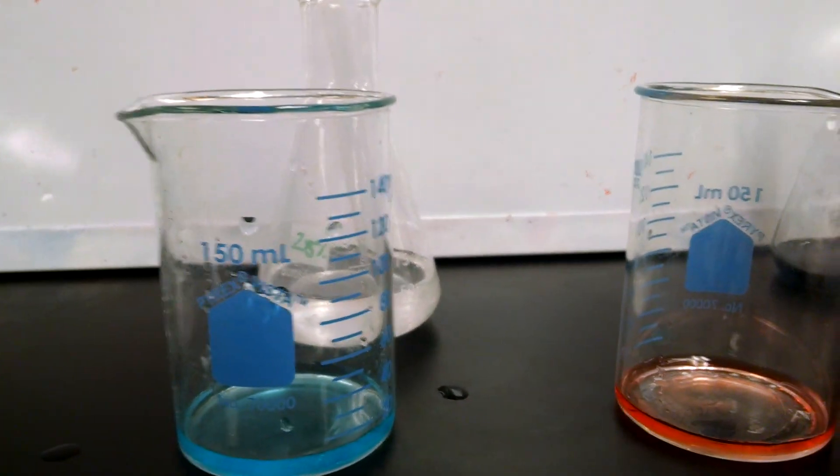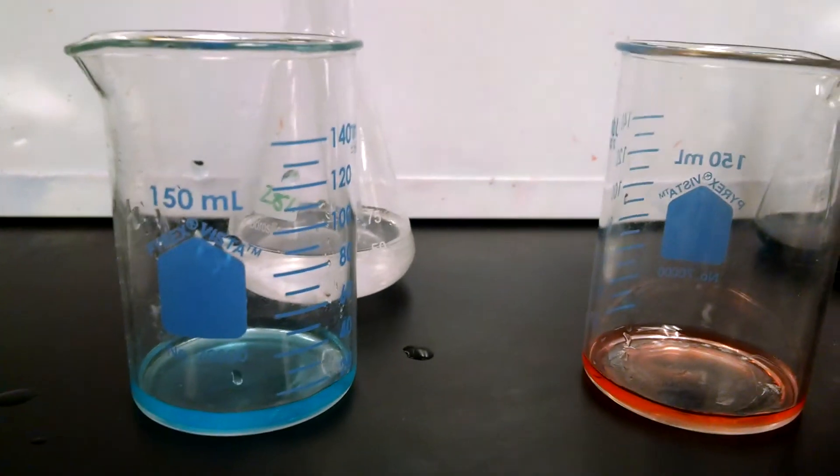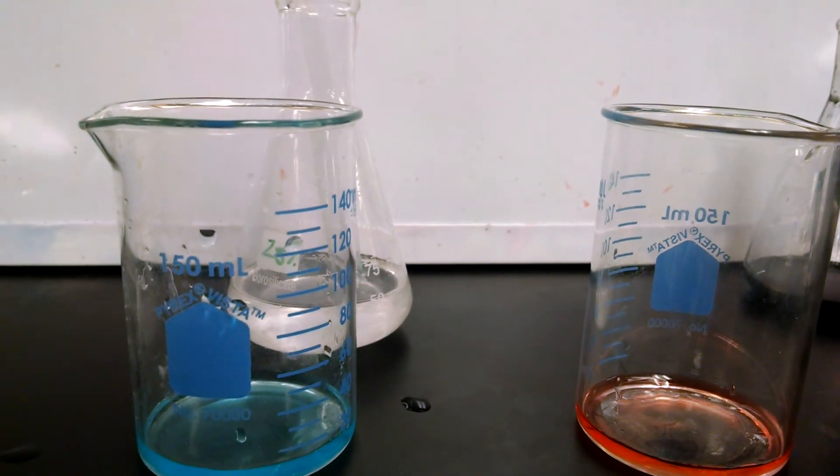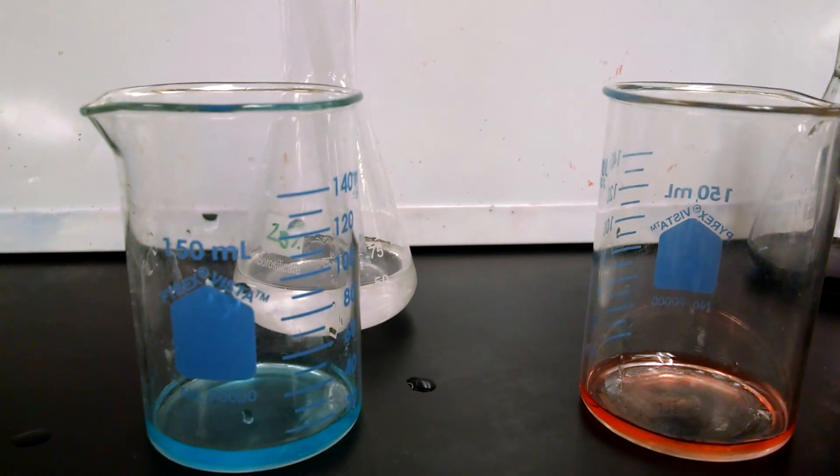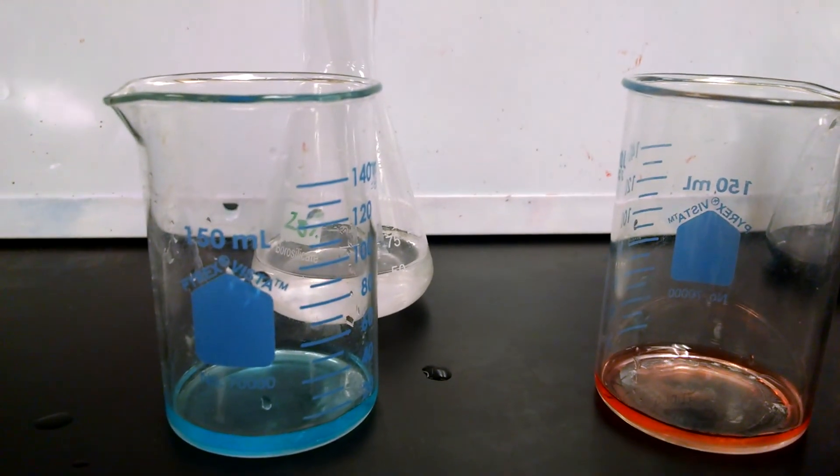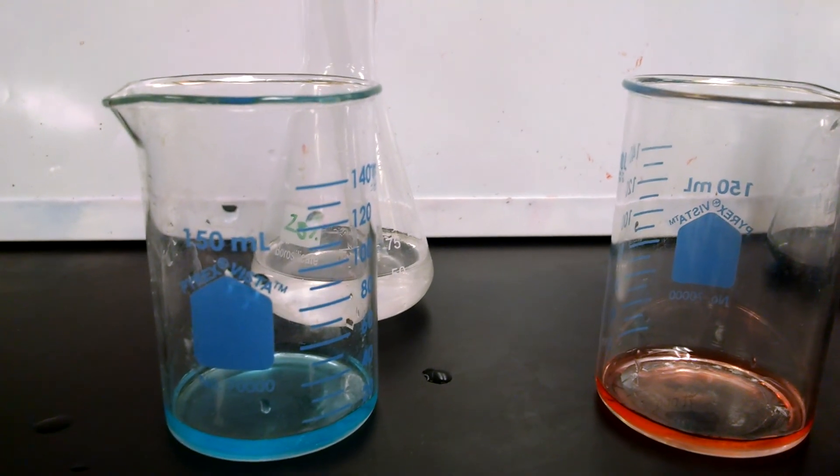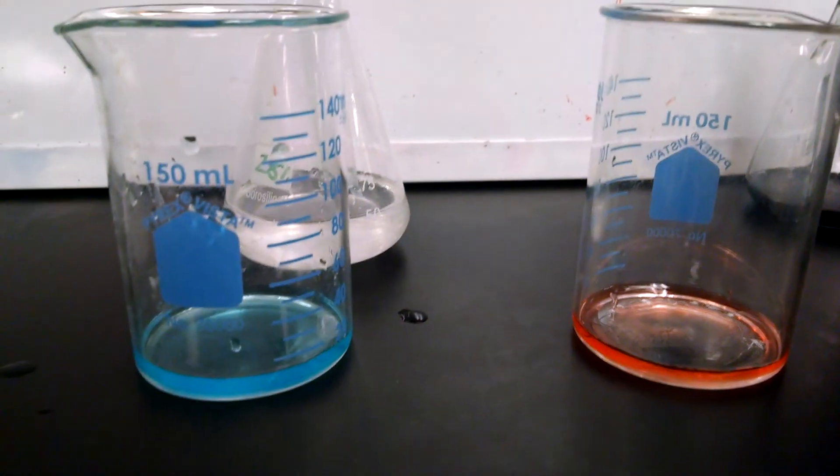So the red comes off first with the 6% and then the blue comes off at the 28%, which is less polar. So we're using hydrogen bonds and different polarities of solutions in order to allow a separation to happen. And again, our column is made out of silica gel, which has water molecules in it, which hydrogen bonds to our purple color, which is made out of red and blue. And that's how it works.